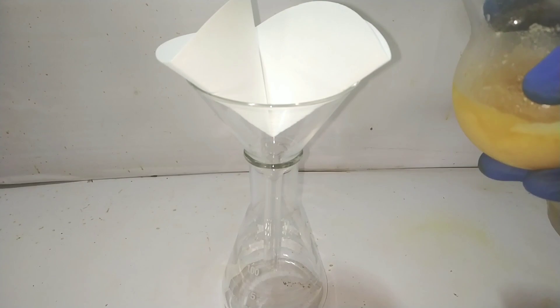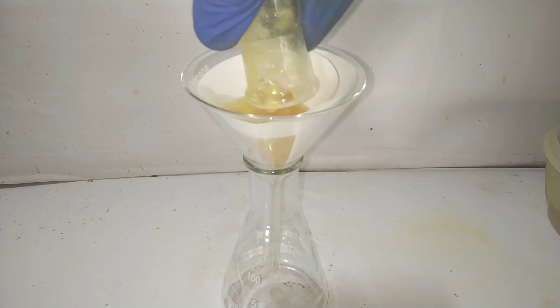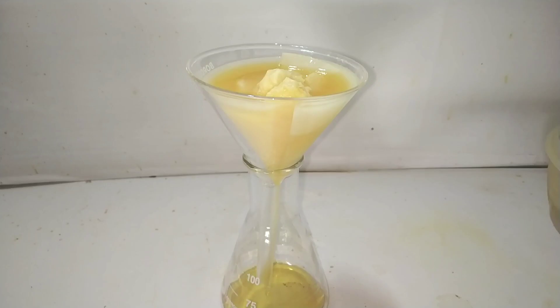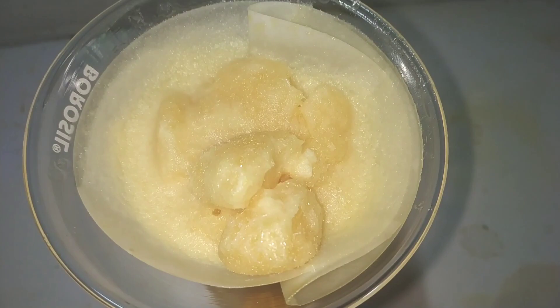A simple filtration setup was arranged and the contents of the flask were poured into the filter paper. After a few minutes, we are left with some crude benzoin crystals which have a yellowish discoloration.